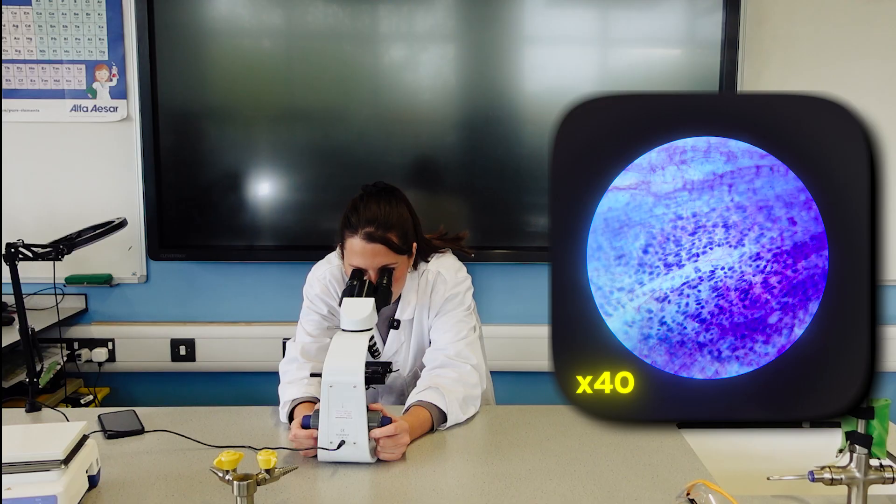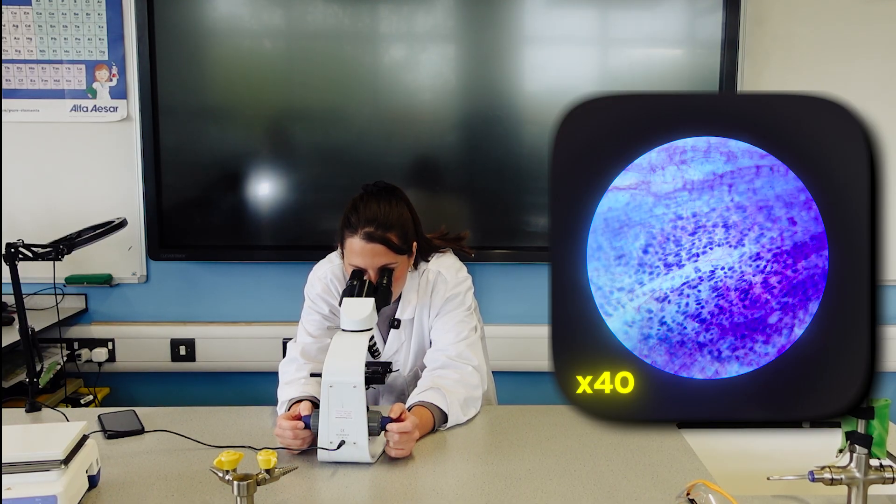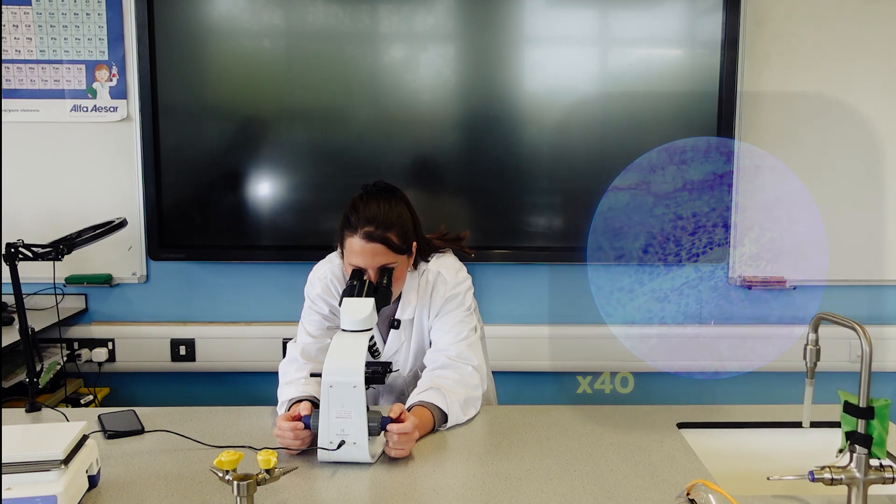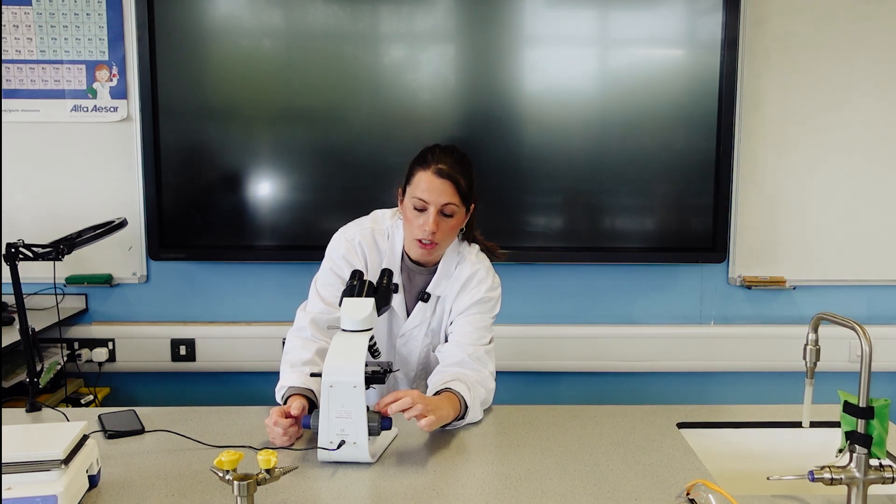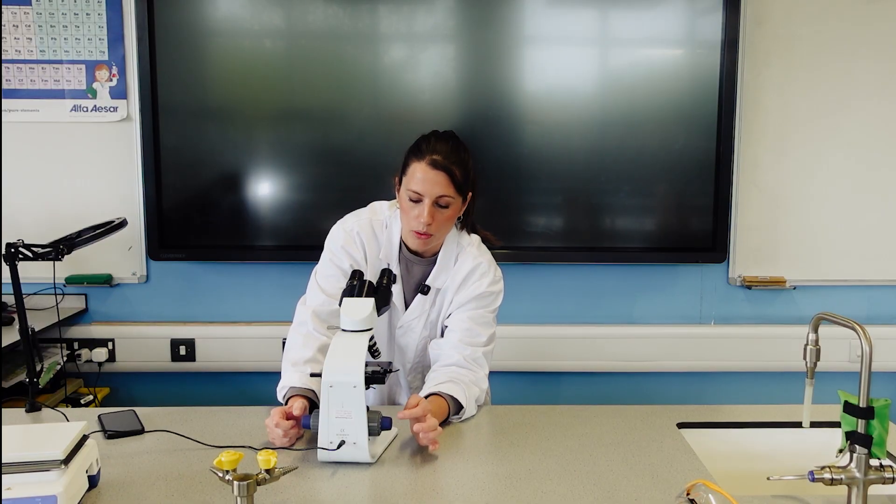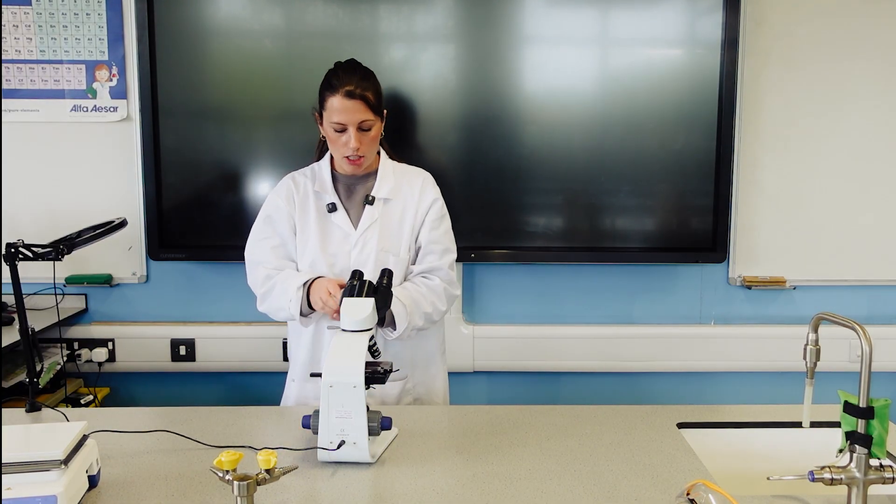Now at this point, it's worth noting, and this is what's happening to me, just tell the students because you're now at such a high magnification, even the slightest change to your focus dials can very quickly make it go out of focus. So you want to be using the fine focus, not the coarse one at this stage.